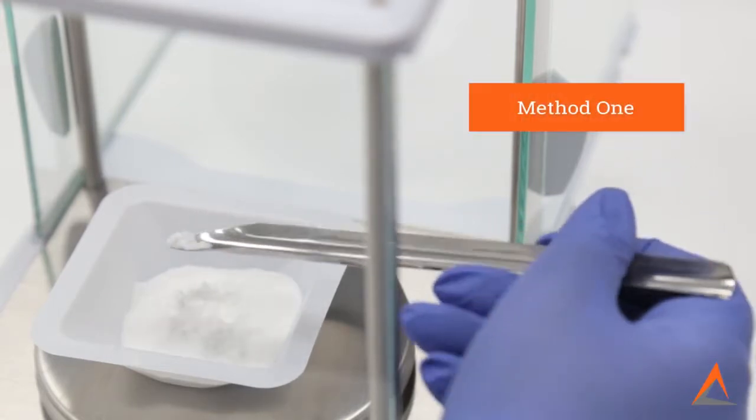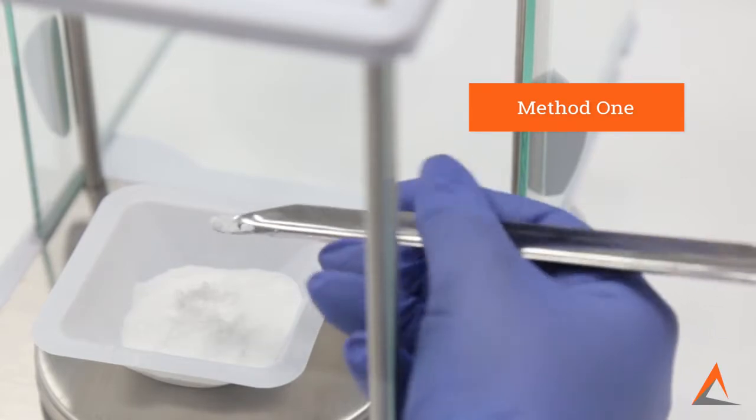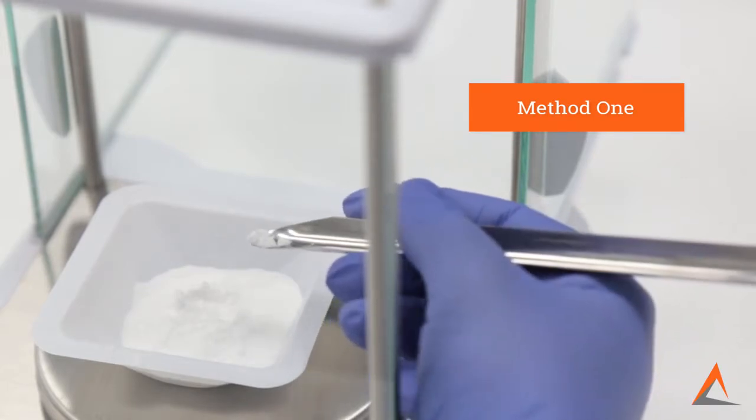Alternatively, using the proper technique, if you move your hand down the length of the spatula so that it is closer to the powder, you will have more control of the spatula.